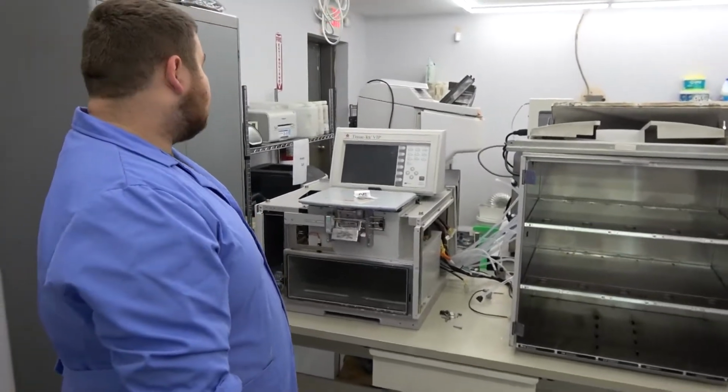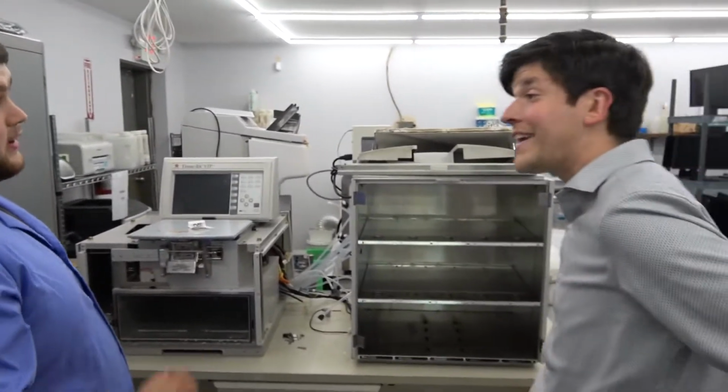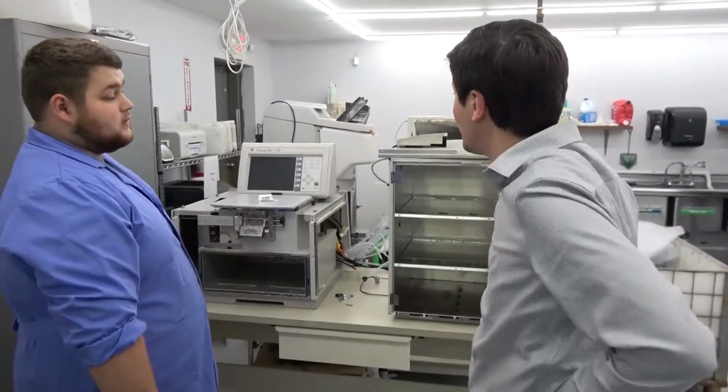VIP5s are coveted tissue processors. They're not 6s, but they're also not E300s, which I guess people don't like as much, you know?